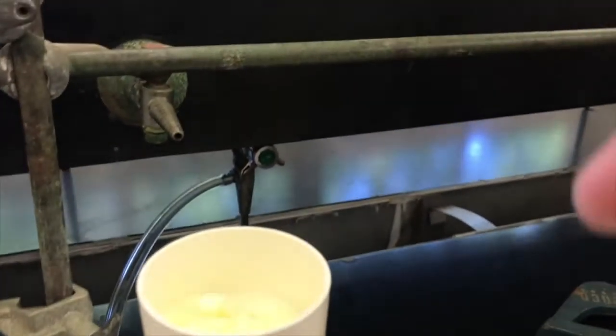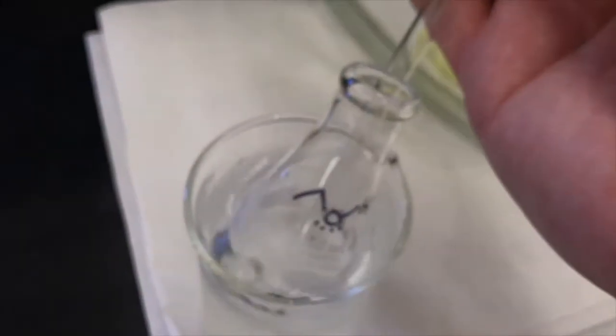Okay, when I look at this, I still see crystals undissolved. So that looks like I can pour this onto my crystals to wash them and not be too concerned about losing a lot through dissolving them. Because I am using ice cold ethanol, I'll do another couple squirts in my flask. The ethanol I'm using right now to wash these crystals, it's not only washing the crystals, it's dissolving them. So I want to be cautious with it.